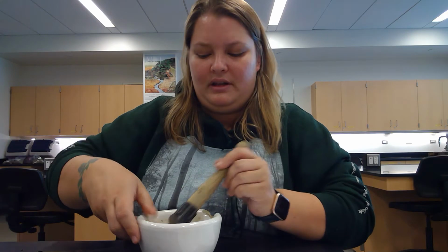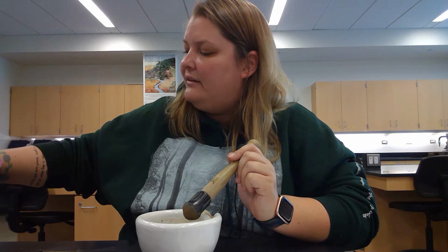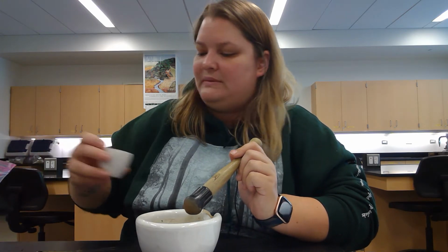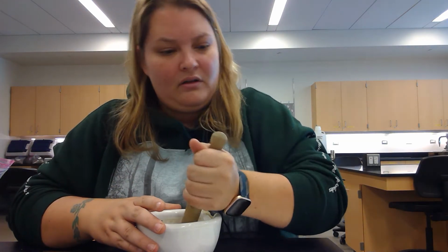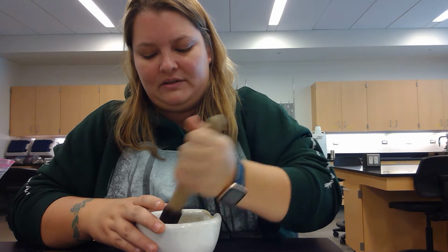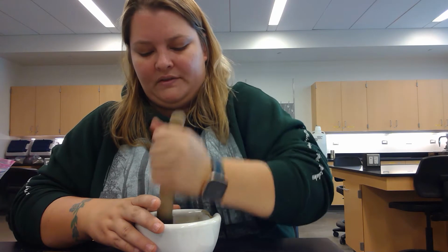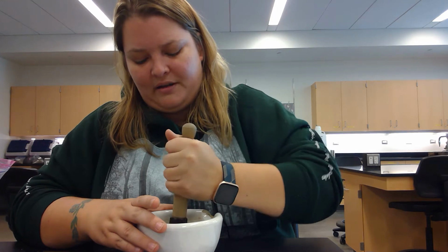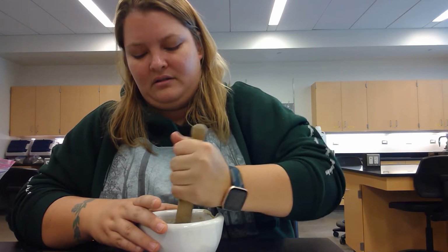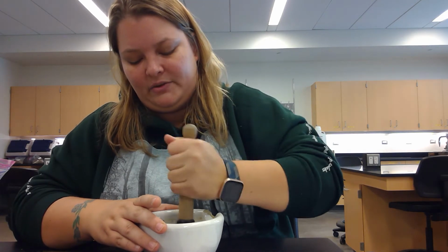The next step is to transfer the soil from the crucible into a mortar. And then we're going to add an additional half crucible just because we are going to pulverize this. And then refill it into the crucible to represent an over-tilled soil. So if you think about tilling practices, they're meant to break up large clumps of soil, but it also makes it very easy to compact the soil then.